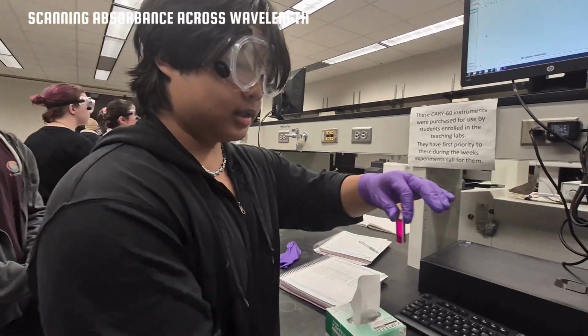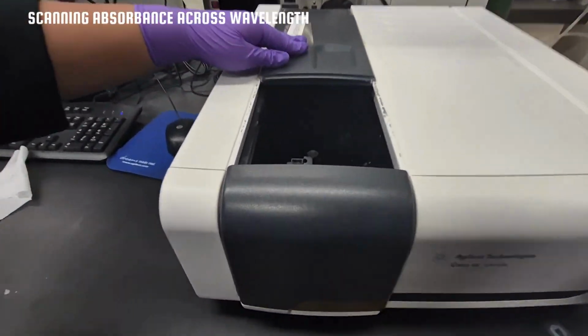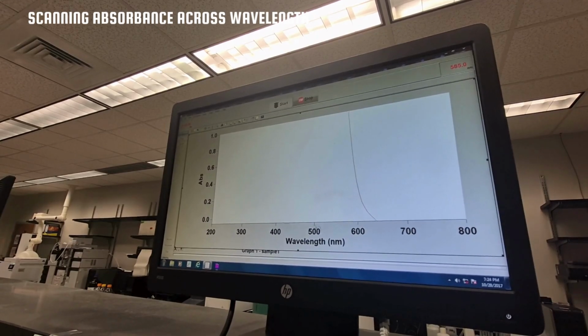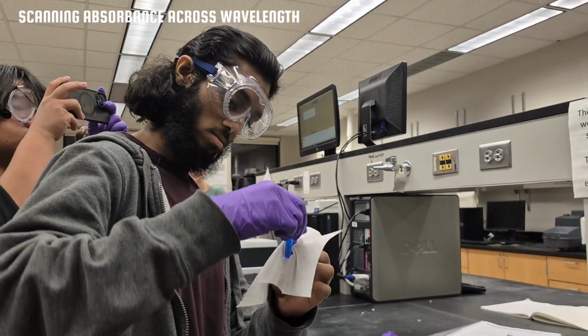Now, we do the exact same process for our 2 samples, cleaning, placing and closing, but instead of zeroing the machine, we press the start button in the top middle. This graphs a wavelength and absorbance curve, the absorbance values of which we will record and use to graph our calibration, Beer's law curve.